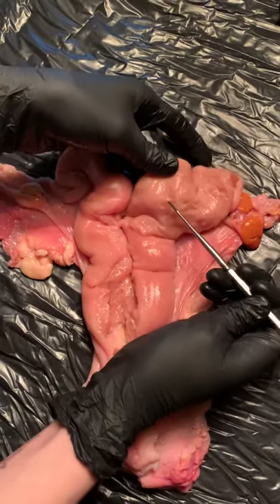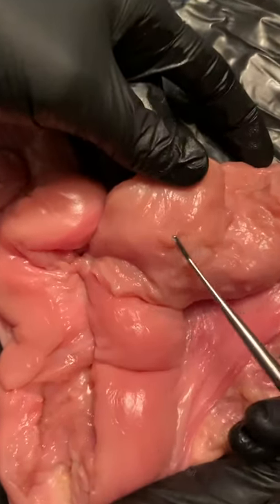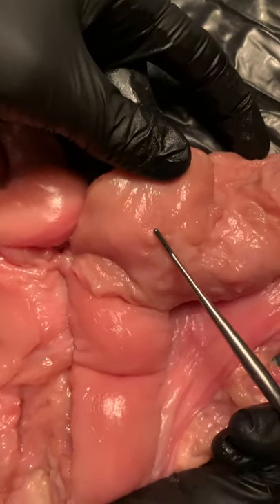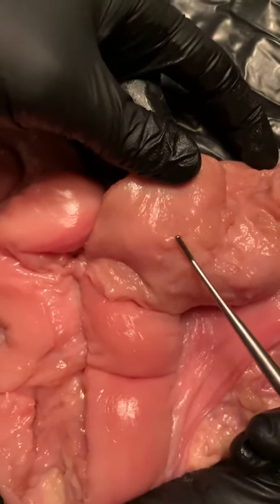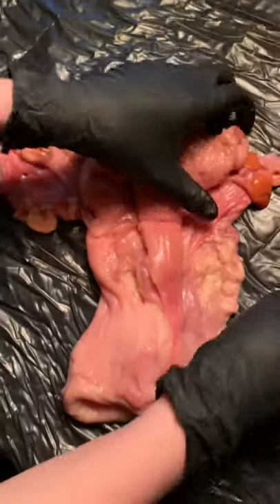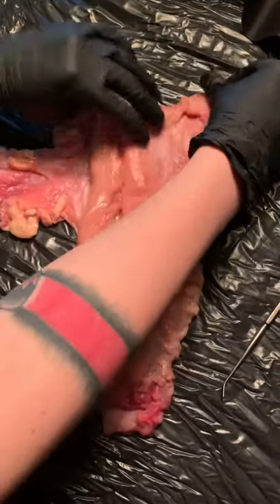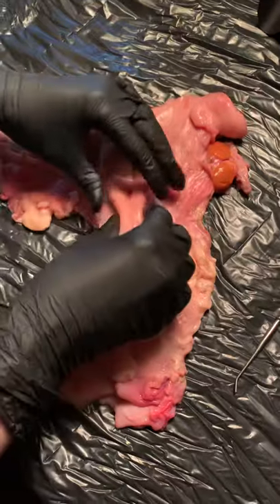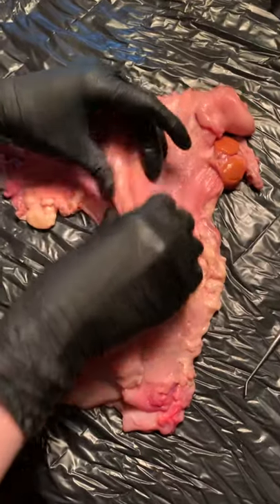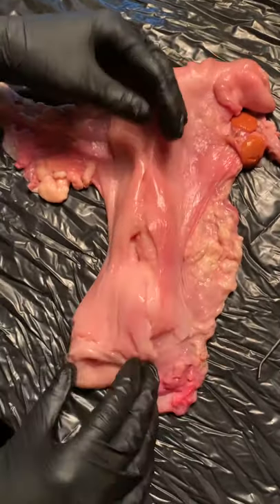There are all these little bumps called caruncles. They're not very visible, but those are the site of the placental attachments. Down from the horns leads to the cervix and then out the vagina.